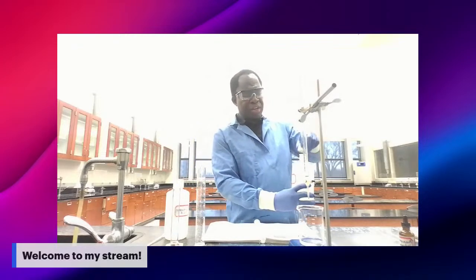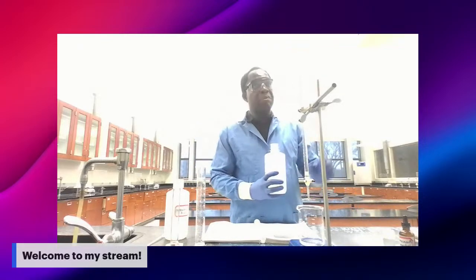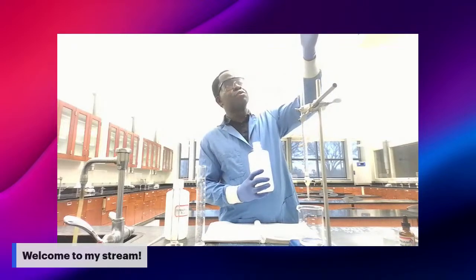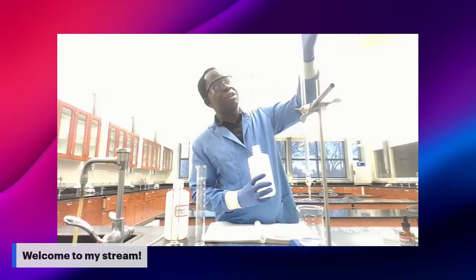So I'm going to fill the burette. Before you fill the burette to the top, you have to fill the burette to 0.